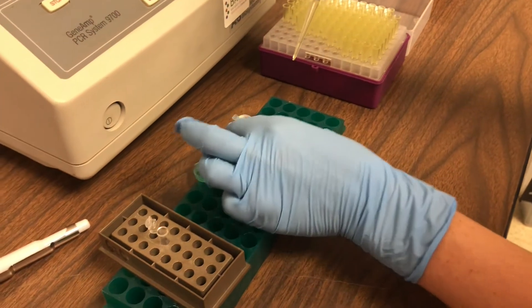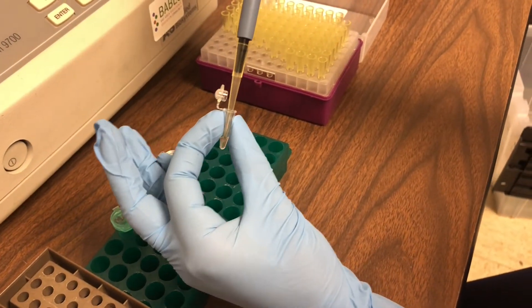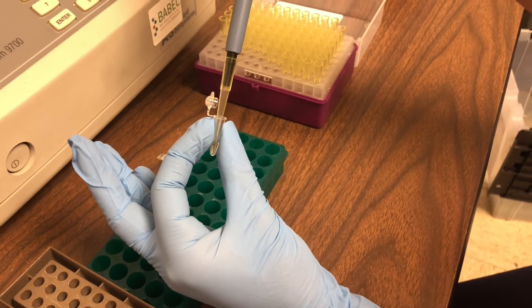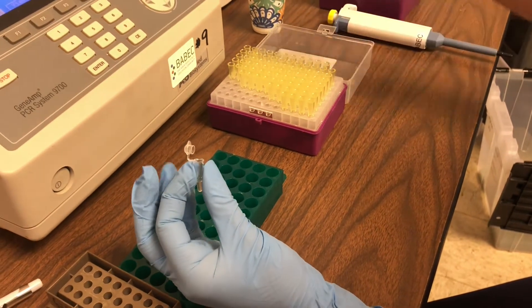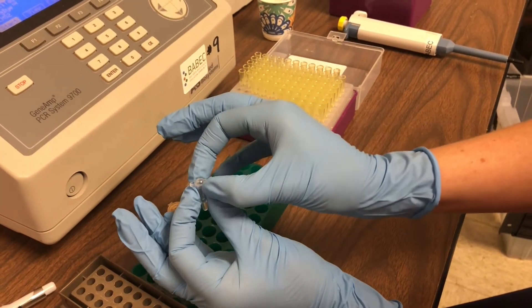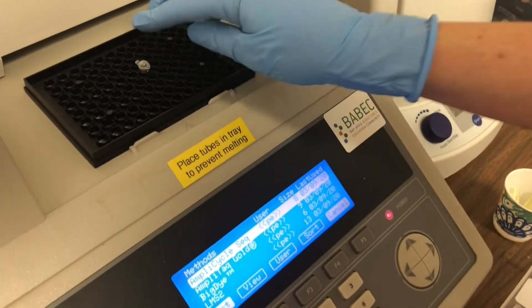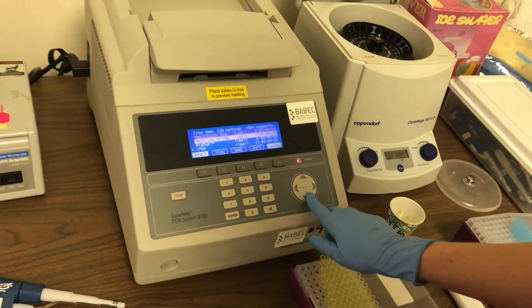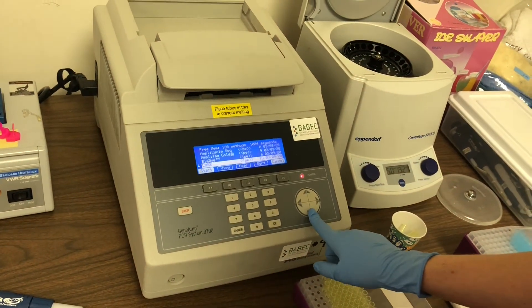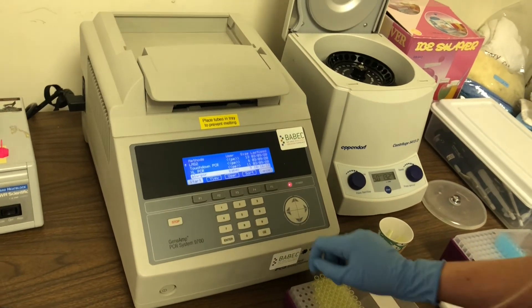So if we think about everything that's gone into this PCR tube: we have our master mix with the Taq polymerase, the primers that are specific for the 35S DNA, and the DNA from the corn chip sample. We then put our sample into the PCR machine, which is called a thermal cycler. It basically heats up and cools down very quickly, and will do typically about 35 cycles in two hours before we move on to the last part of our lab.